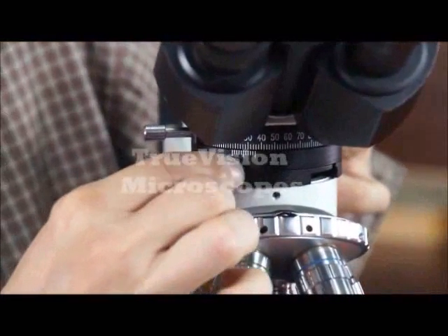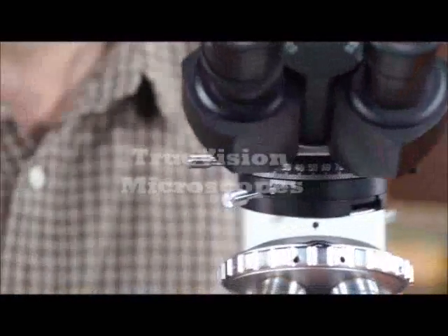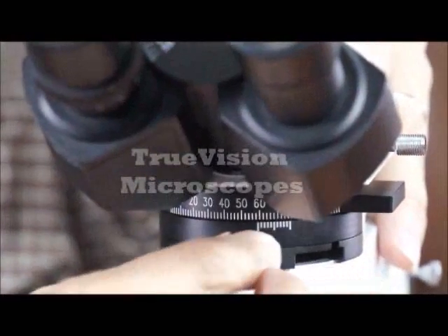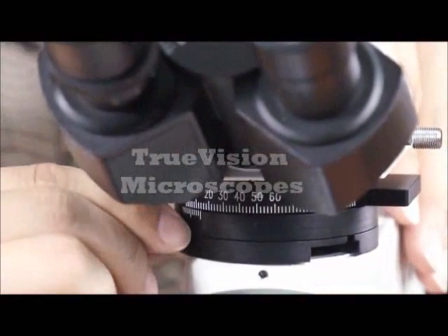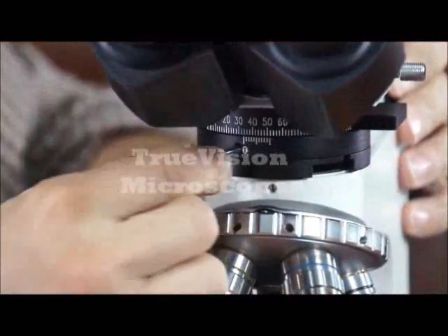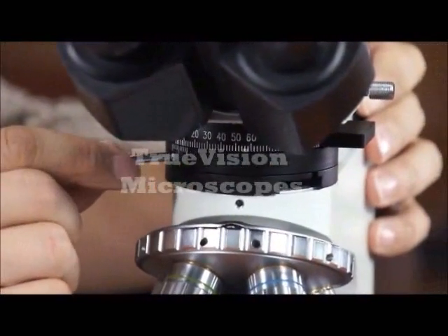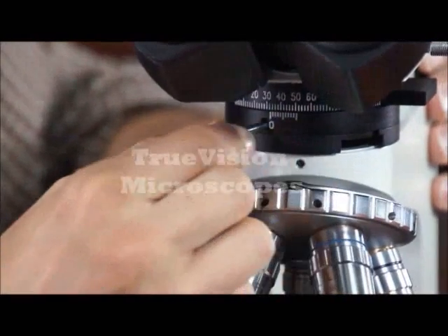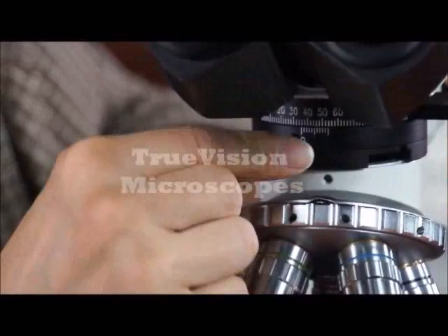This is the analyzer — a polarizing lens that travels 90 degrees. When pushed in, the polarizing lens is in place. When pulled out, it takes the polarizing lens out of the optical path. So if you don't want polarization, you pull it out. Push it back in to have polarization in the analyzer.